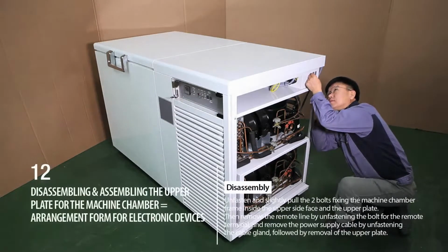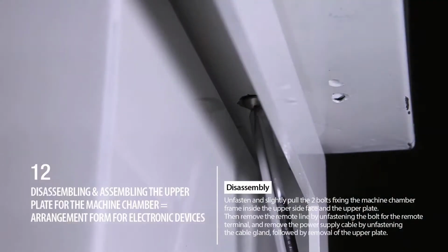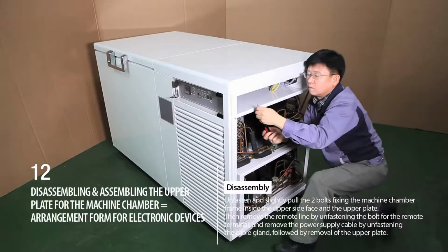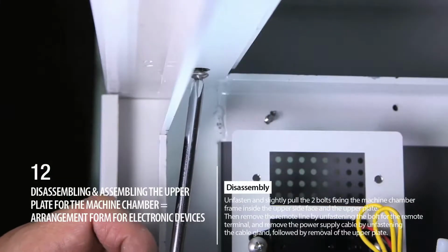Disassembly. Unfasten and slightly pull the two bolts fixing the machine chamber frame inside the upper side face and the upper plate. Then remove the remote line by unfastening the bolt for the remote terminal, and remove the power supply cable by unfastening the cable gland, followed by removal of the upper plate.